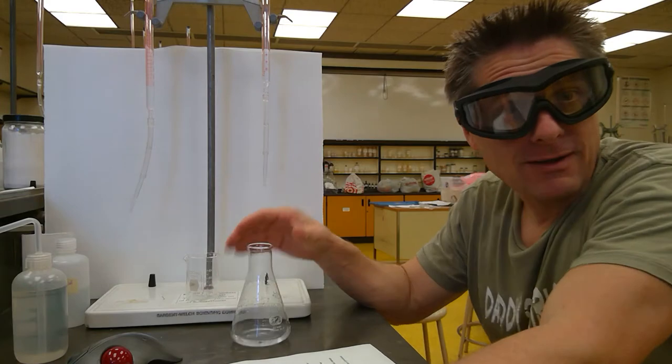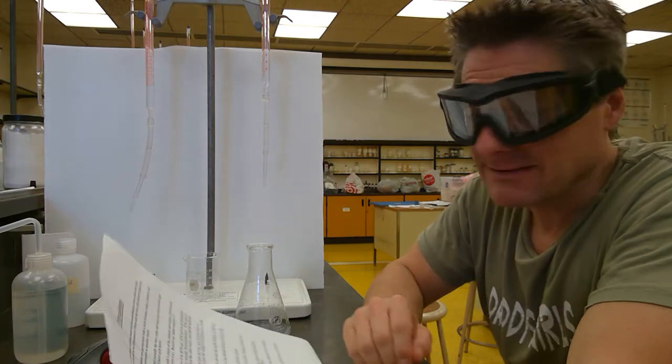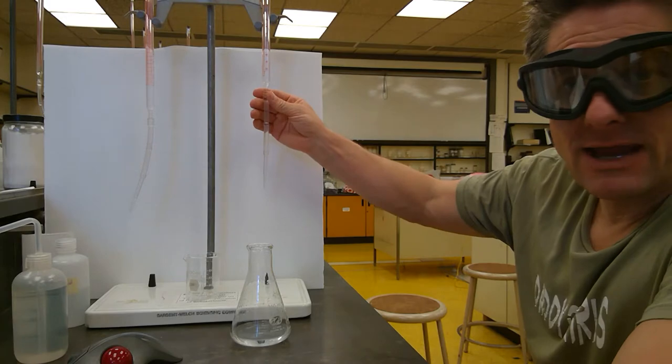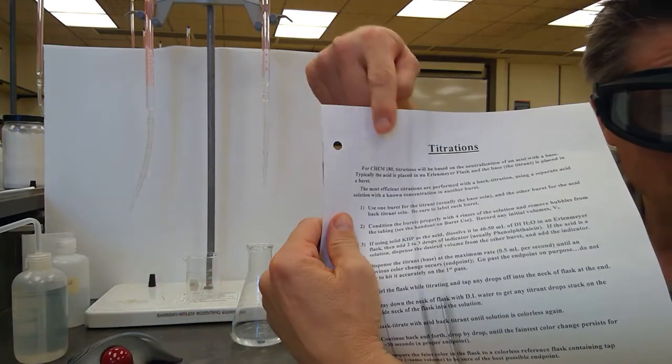You can't screw up, right? With back titrations, you can't screw up. If you don't like your color, you can just back titrate, turn it colorless, and add some more base. It's a wonderful method there. So usually the base will be our titrant and the acid our back titrant. Not always, but typically. These have already been conditioned, so I'm just reading through the steps here.